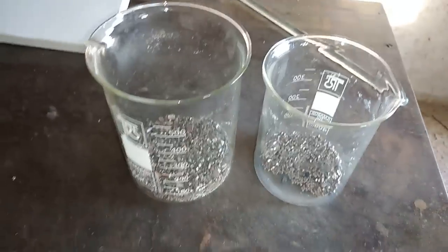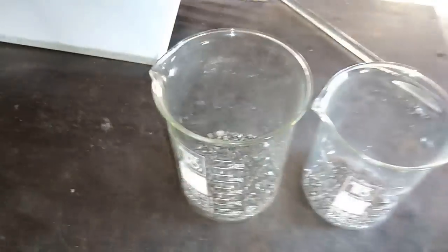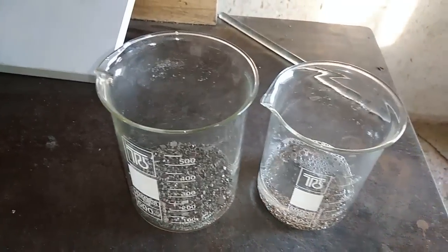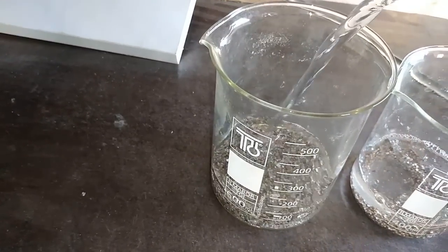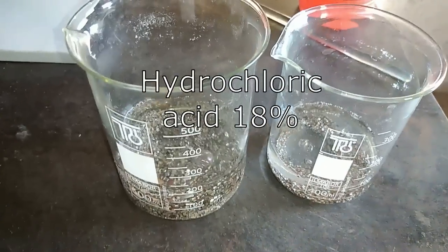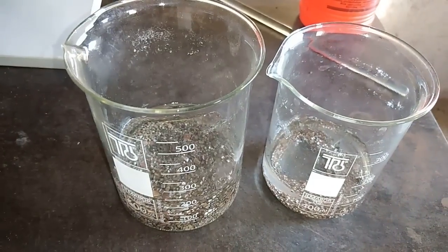I will add hydrochloric acid now. First, the non-magnetic - I think 100 ml is just enough, maybe too much. And here, this is a bigger amount, so I'll add 200 ml. I will put both beakers on the heat and leave them for a couple of hours to remove all the tin.